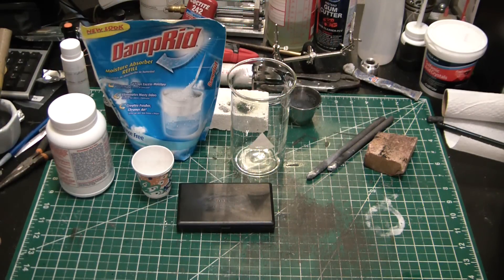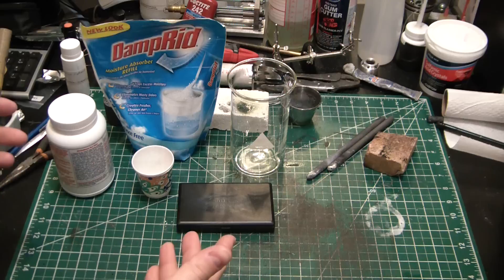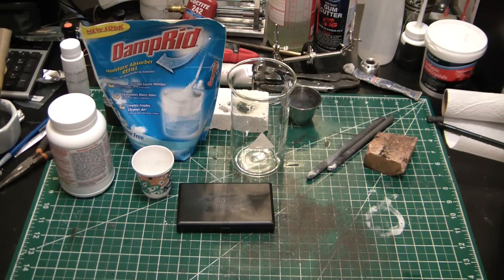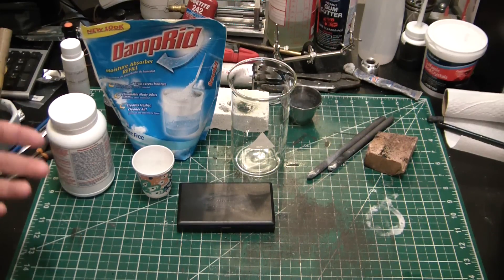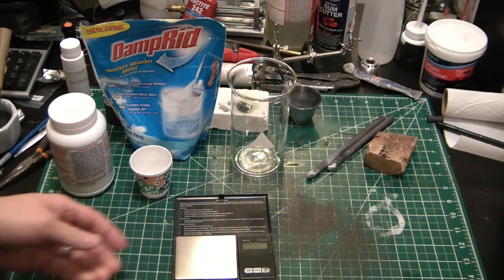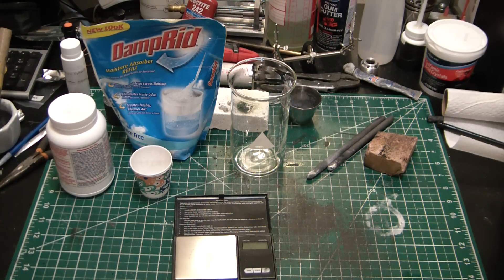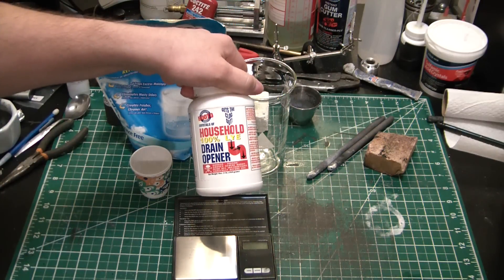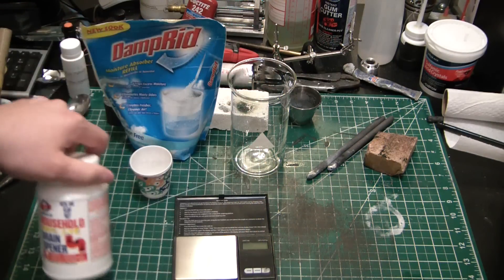So I need to make some more. Today we're just going to be doing a quick double displacement reaction to make a bunch of calcium hydroxide. Super simple, doesn't get easier than this. This could be a fun little project to get your kids into chemistry and help them understand some basic double displacement reactions. Although we're dealing with some sodium hydroxide here, so that aspect of it is a little dangerous - nice and caustic.